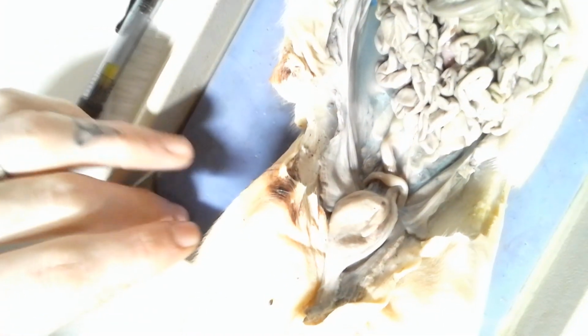Okay, and so doing a quick little overview on the list here. I don't see anything that I have missed, and so review this video a few times to look at the structures. I will be using this particular pig for the lab exam. I will be taking individual pictures of this pig, so you want to make sure you are familiar with what all those structures look like, and of course ask me any questions you have, whether on the forums or through emails. So alright, good luck studying the pig in the next couple of weeks.